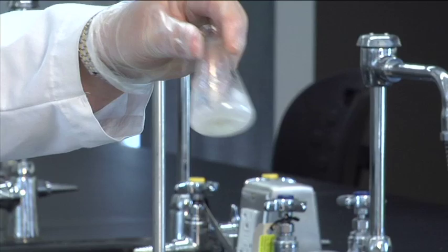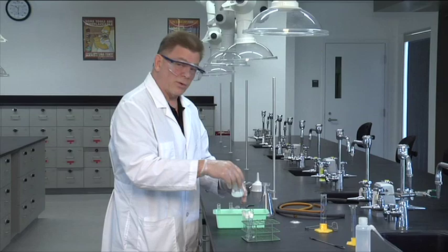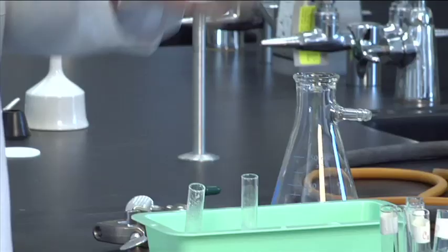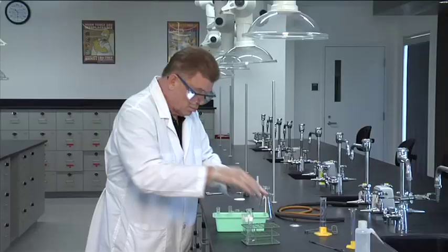You can see a nice slurry of crystals. By the way, these beautiful crystals to a chemist, this is a lot more fun than sticking a pin in a frog spleen over in bio. So this is a lot more fun. All right, that's going to go into the ice bath while we prepare for the vacuum filtration.